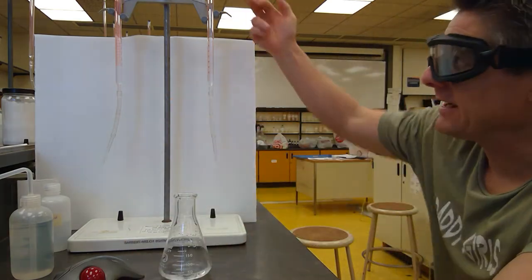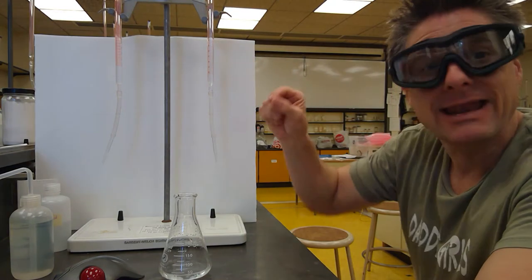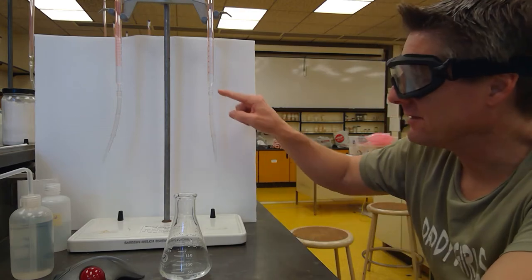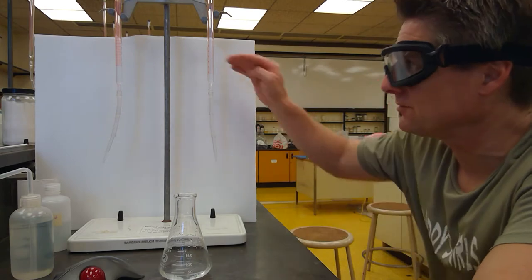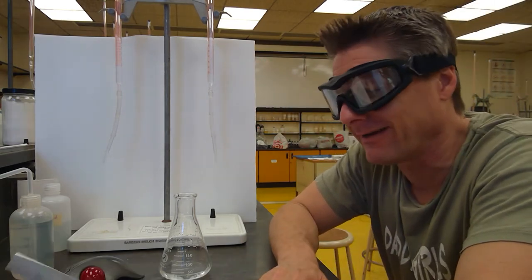So if you're ever titrating, adding base, and you're getting down towards the 50 line here, stop and add two drops of indicator. It'll probably turn really pink, and then back titrate, because you can't go below this 50 line because there's no lines there. You couldn't read a volume. So if you get down here, stop. If you can't figure out what you're doing, ask your instructor.